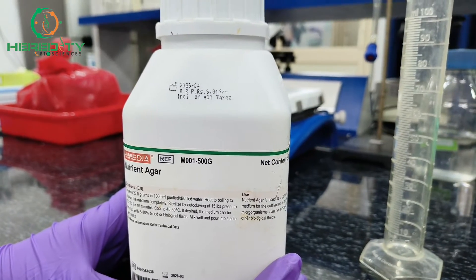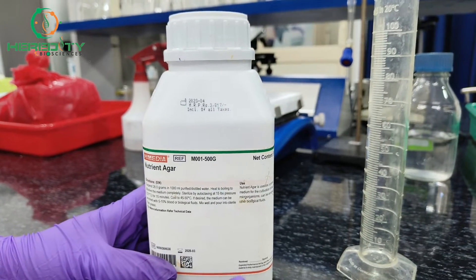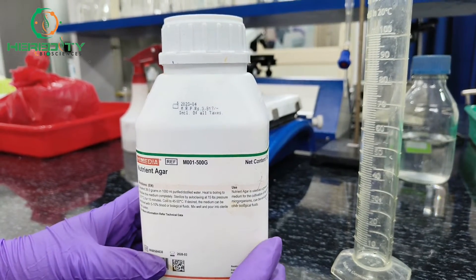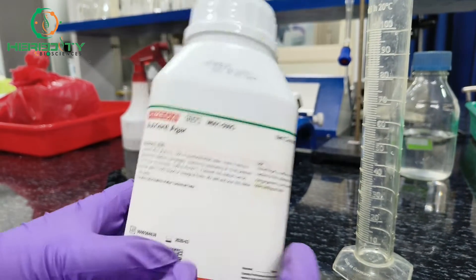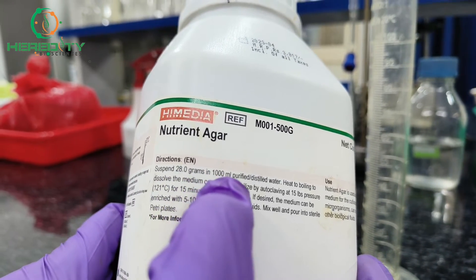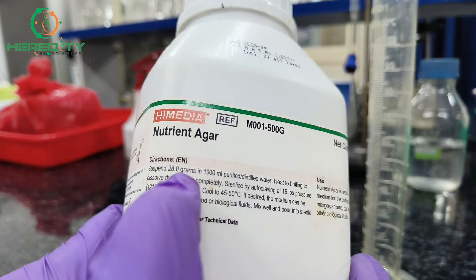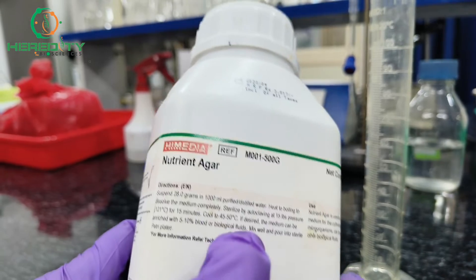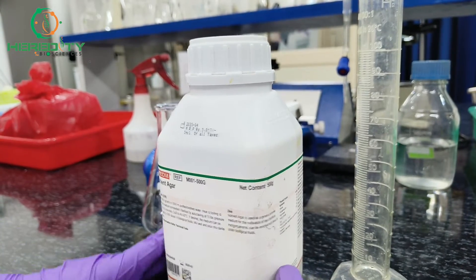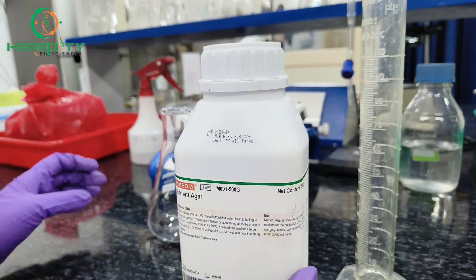For the preparation of blood agar, we need nutrient agar. Now we will make 100 ml of nutrient agar. The label mentions 28 grams per 1000 ml, so for 100 ml we need 2.8 grams. We will measure 2.8 grams of nutrient agar.